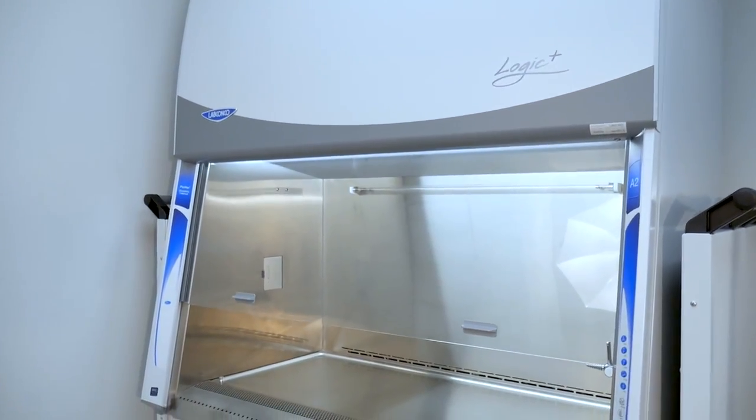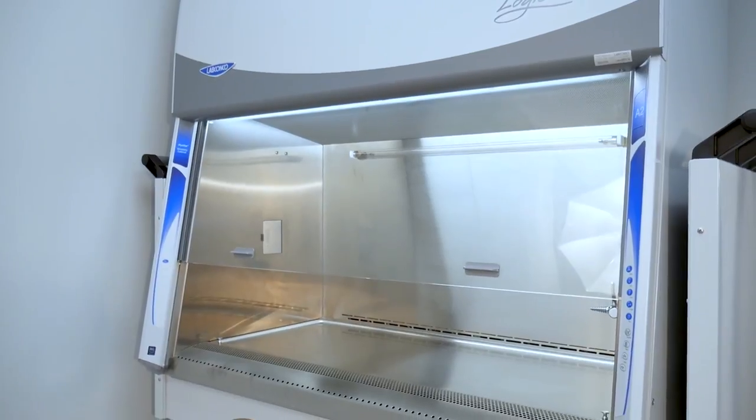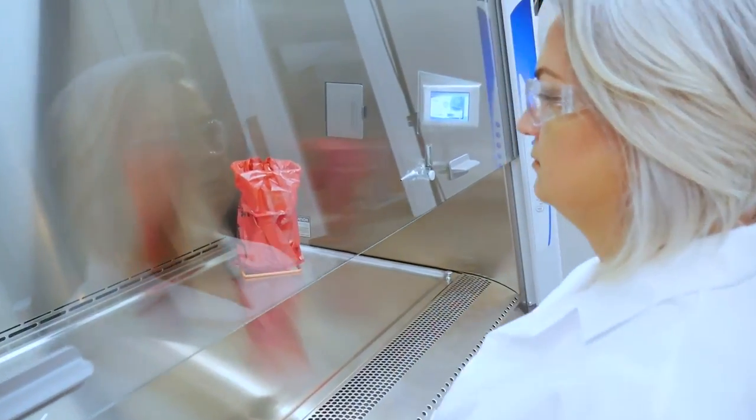LabConco Biosafety Cabinets are carefully constructed to maximize safety, performance, and comfort.